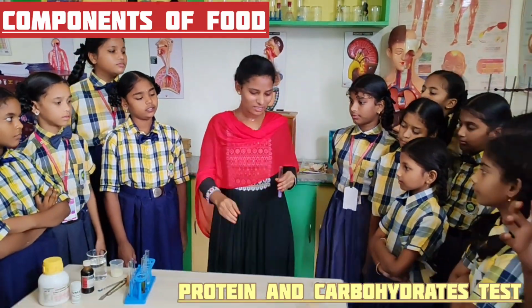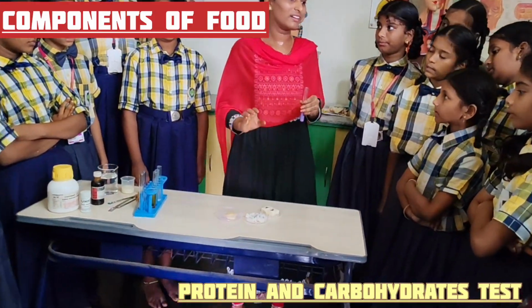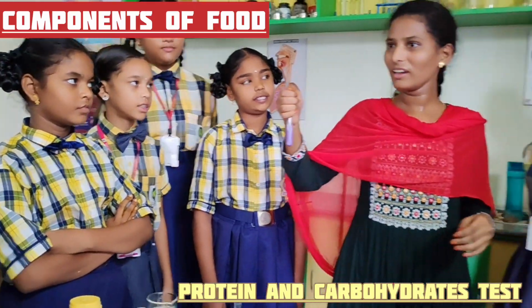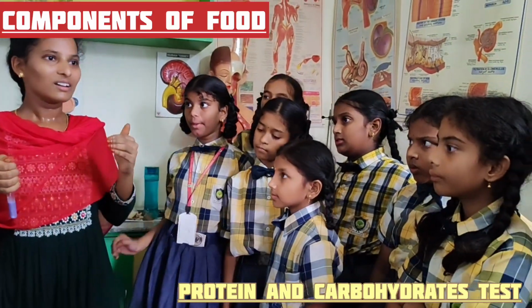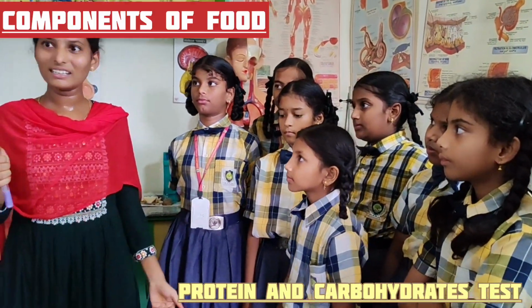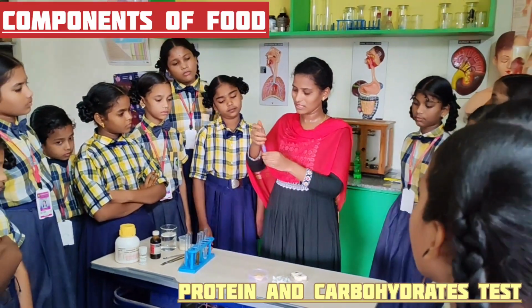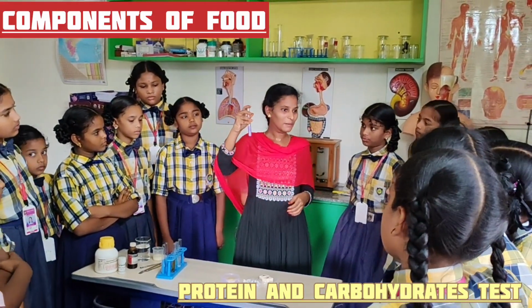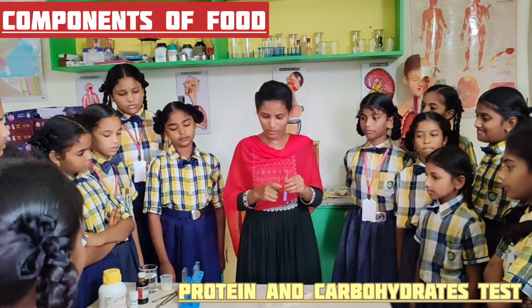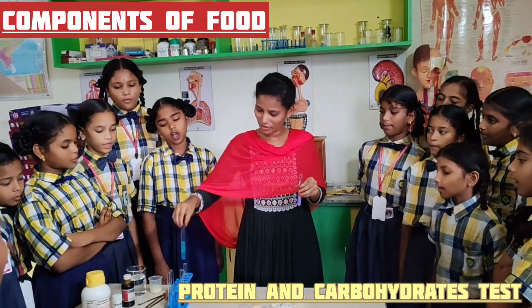Okay? By using these methods, we come to know rice, bread and potato pieces are rich in carbohydrates. Milk is rich in protein. So we just learned those topics theoretically, but now we learn practically, experimentally, which type of component is present in these food items and in milk. Is it clear now? Which solutions are needed for protein test? Sodium hydroxide solution, copper sulfate solution.